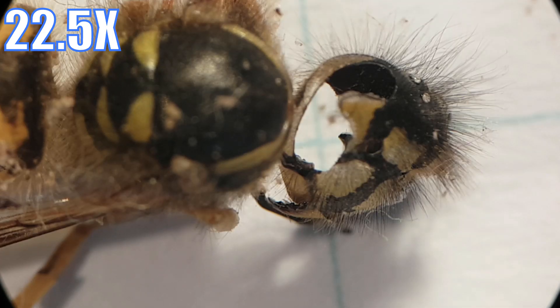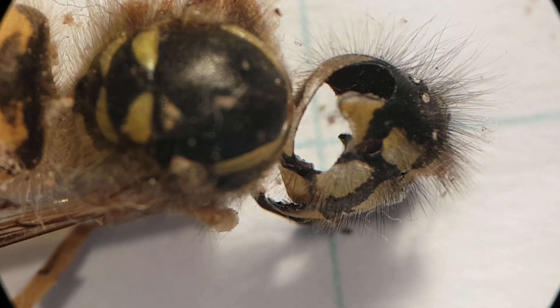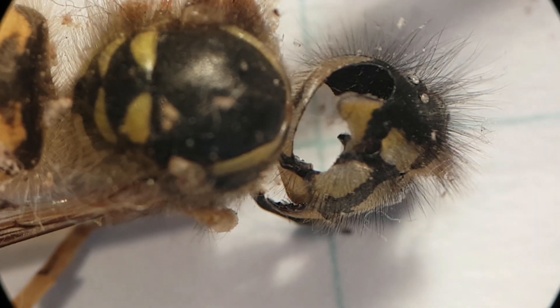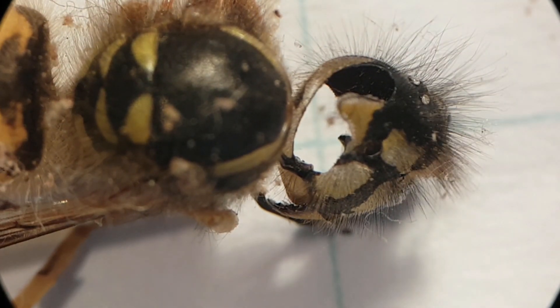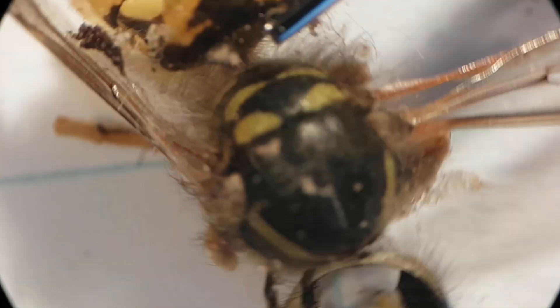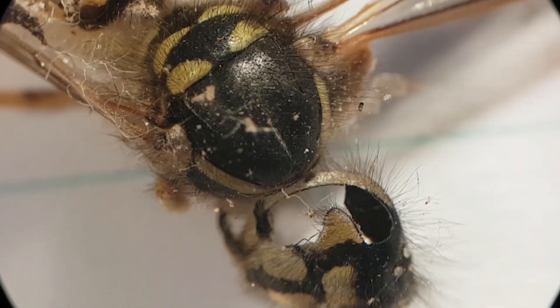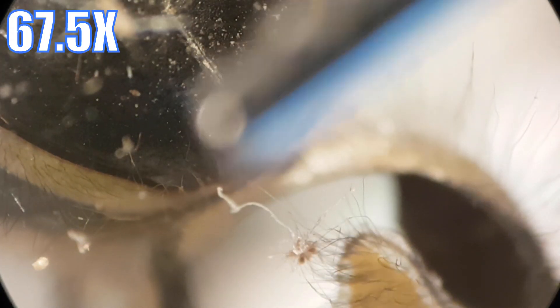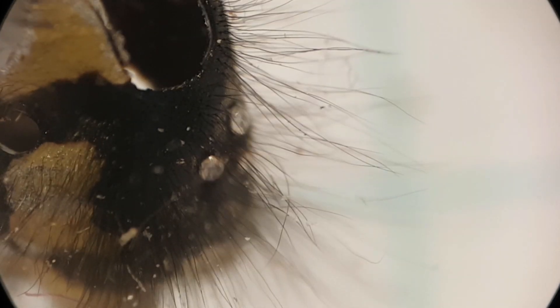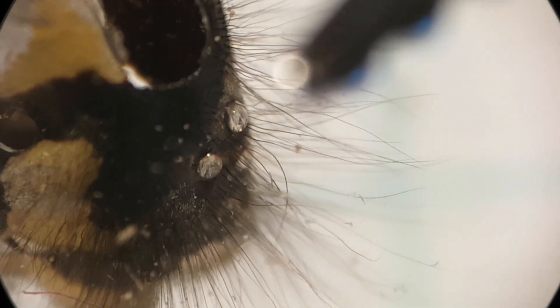Another request was to look at some dead bugs. What you see here is a wasp, and it's in pretty bad shape — it's been lying on my windowsill for who knows how long. The inside is all rotten away but the outside is still okay. Let's go to a higher magnification. You can clearly see that the wasp has a lot of hairs, which is kind of neat, and little droplets of something — probably just water.